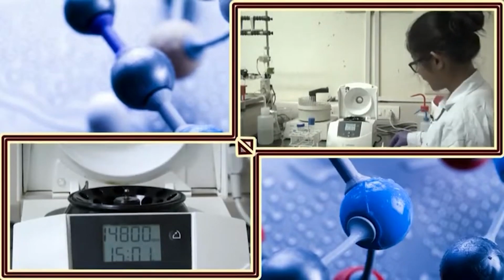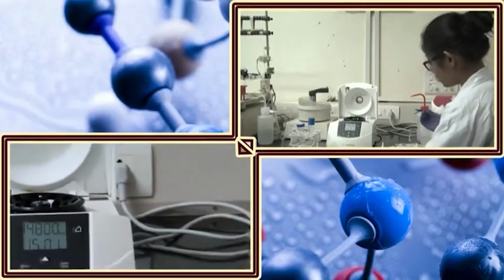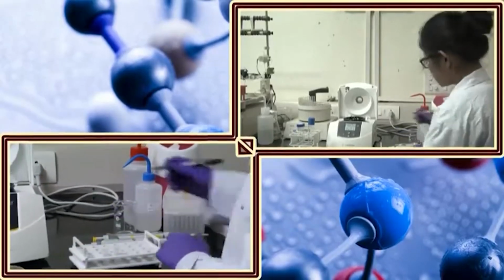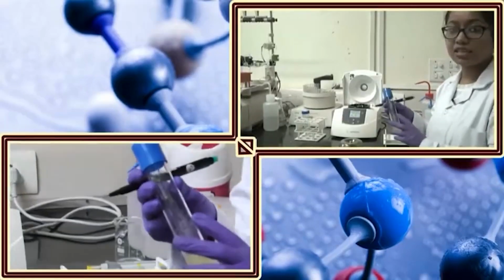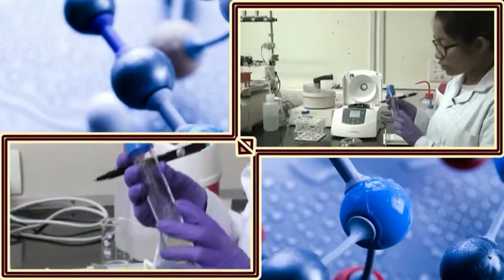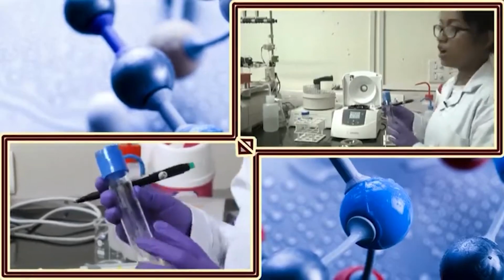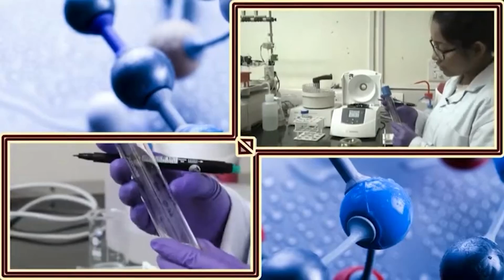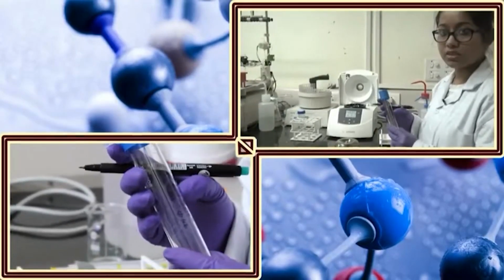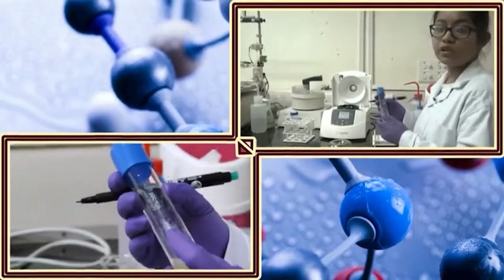Now, I will take my culture in the small centrifuge tube. Before that, I will label it properly. Here also I have labeled what kind of plasmid or what kind of culture I have given. It is a good practice to always label your culture tubes or any kind of solution you have in the lab. You give the name of that particular culture, then you give the date, like when you have put the culture.